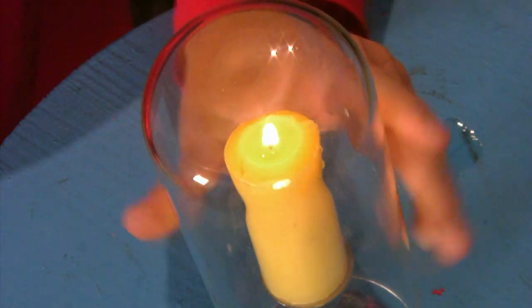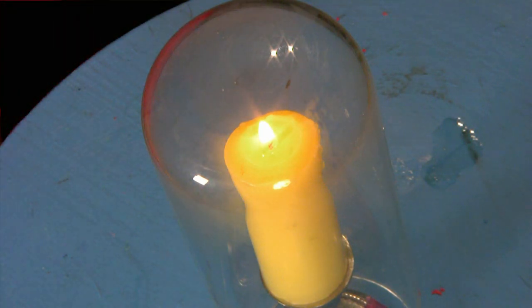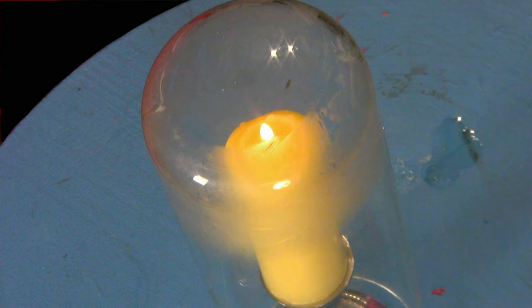Here is a jar of air. I place it over a candle, and it burns very nicely in it at first, showing that what I have said about it is true, but there will soon be a change. See how the flame is drawing upwards, presently fading, and at last going out.